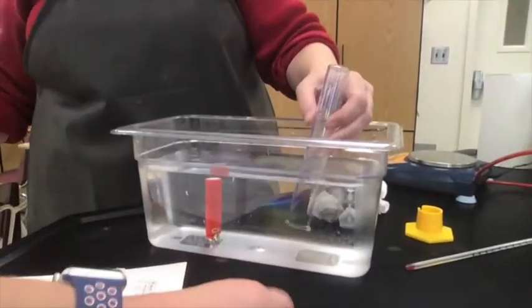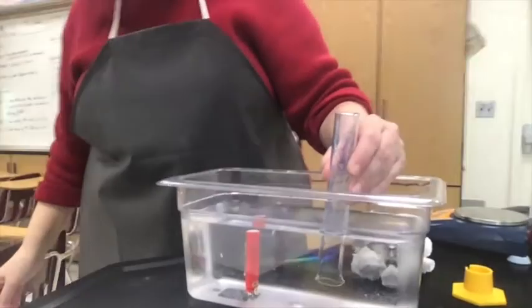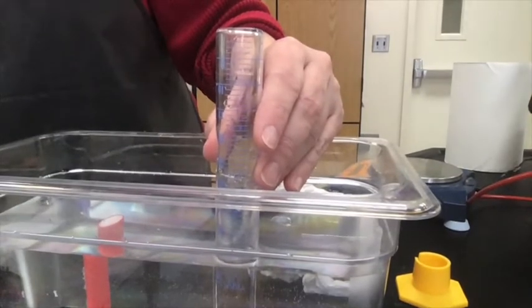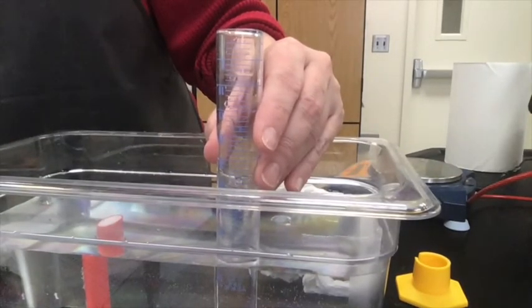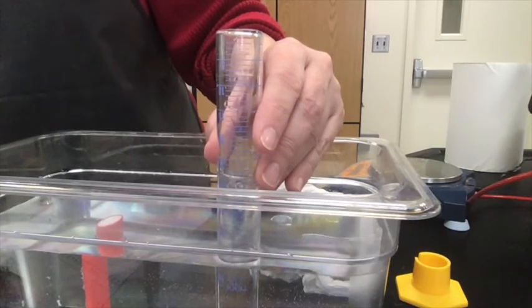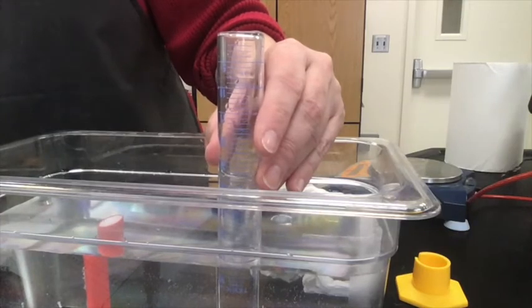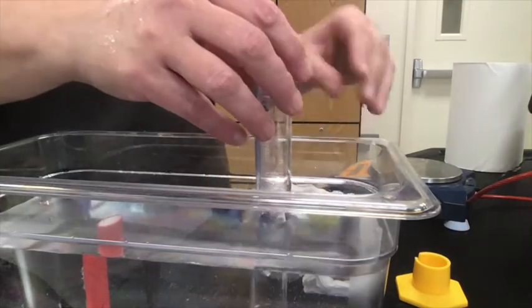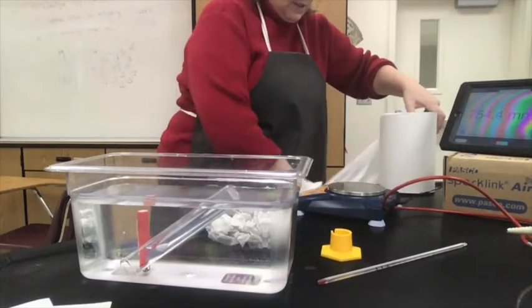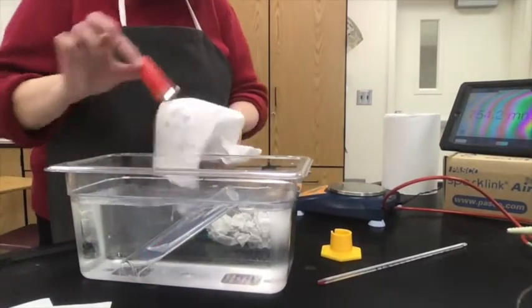Coming back to Ms. Thomas — she's got her sample for trial 3. Reading the graduated cylinder at eye level: I would say it's about 48.0 milliliters. That's your volume for trial 3. Now shaking out the lighter and getting the mass.